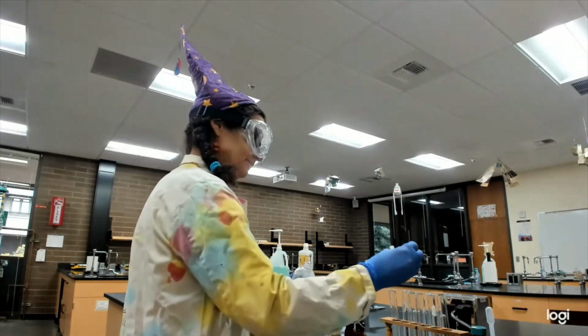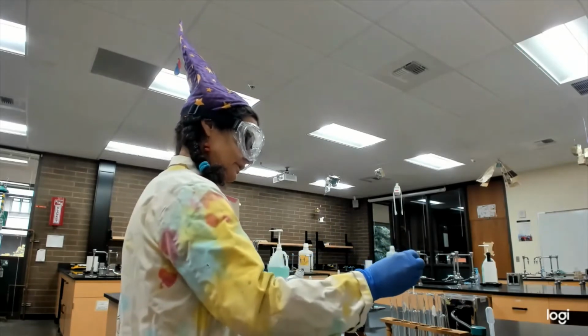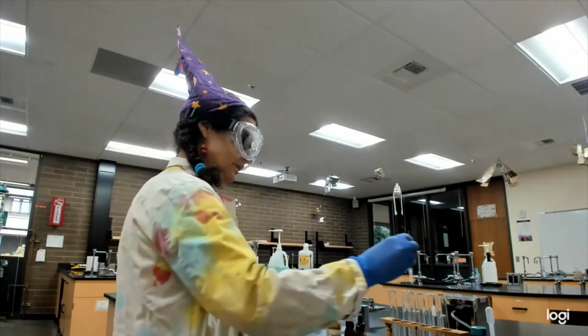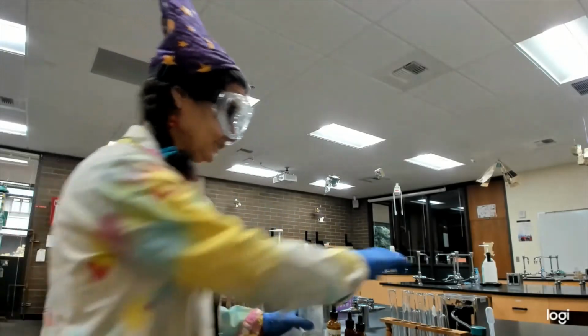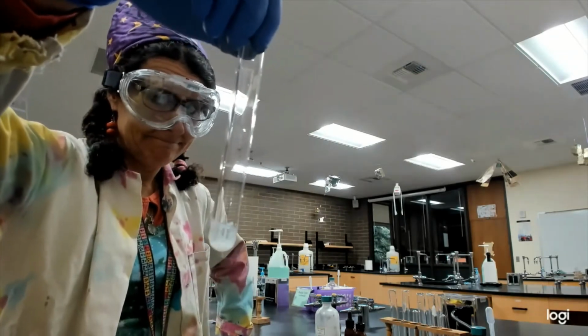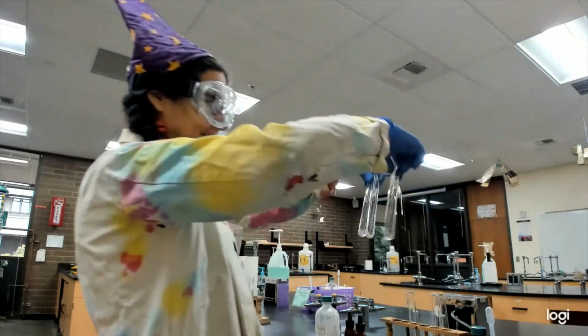That was 20 drops. Oh, we got a winner. I was a little worried because if this isn't made up fresh, it doesn't work. But one of them reacted immediately. The tertiary. The others, nothing's happening.